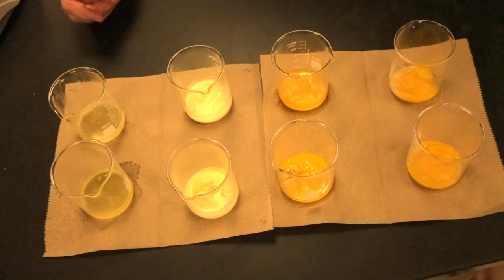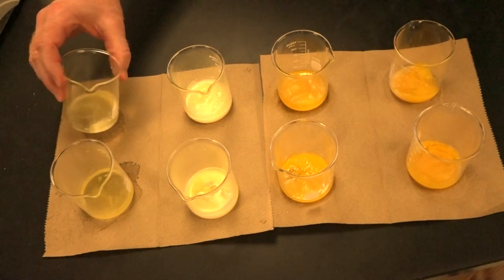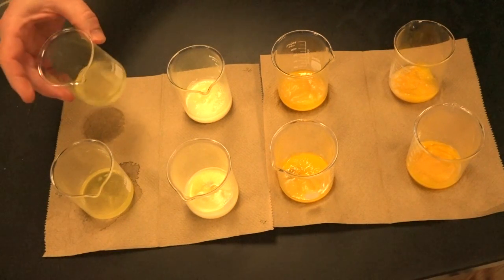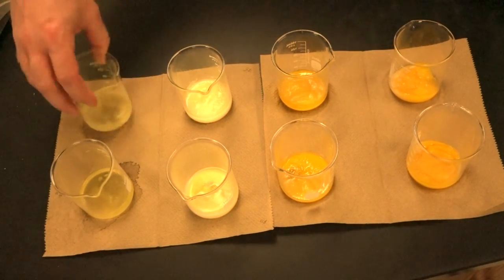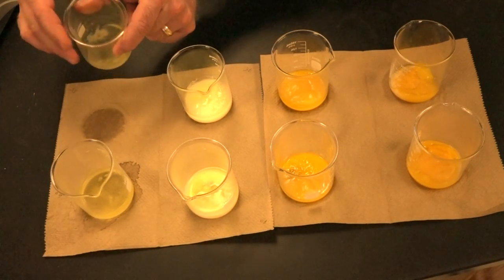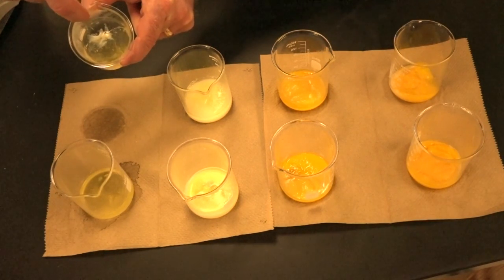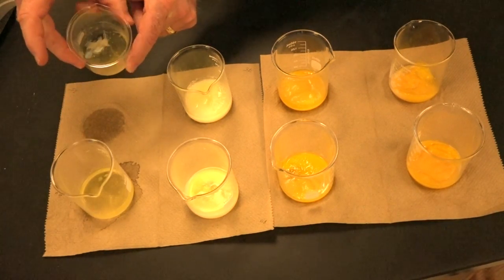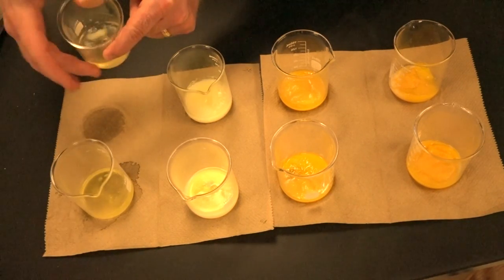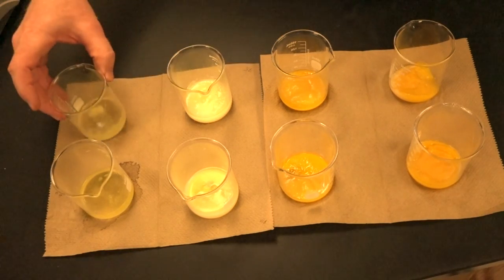Okay, then we're going to move on to 65°C with the egg white. So go underneath the appearance of the egg white at 65°C. Okay, again, transparent, translucent, and opaque. I want to hold this. Miss Hall, you kind of helped me with the video there. Okay. Can you all see what's happening right down here? Can you see that okay? So this egg was starting to denature at that 65 degree temperature. The majority of it is still translucent, but we're starting to see some denaturation of that egg right down there, okay?